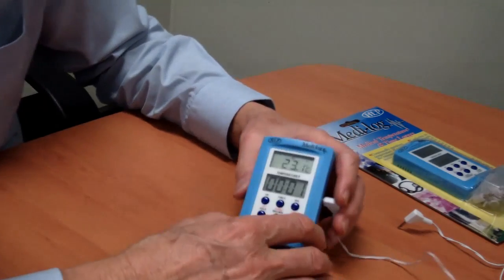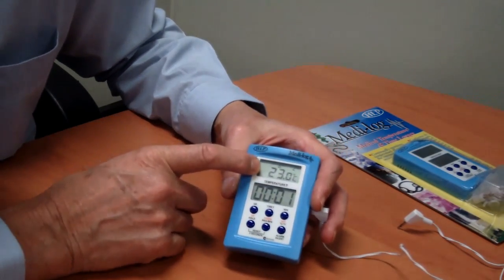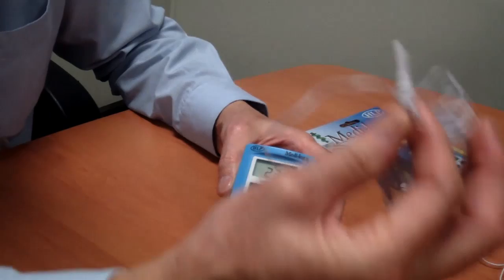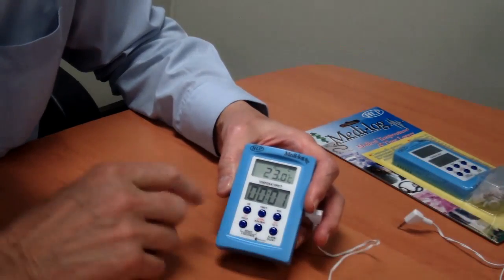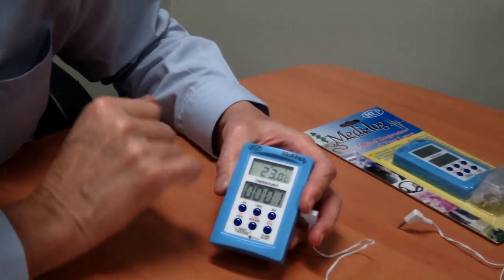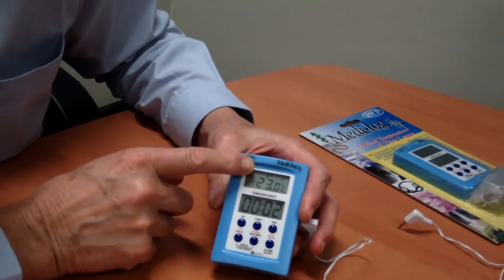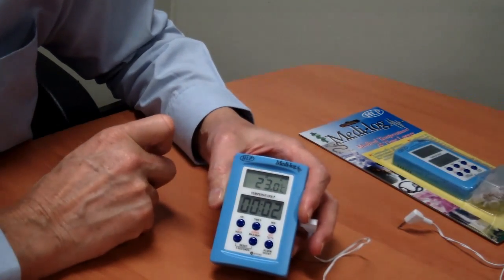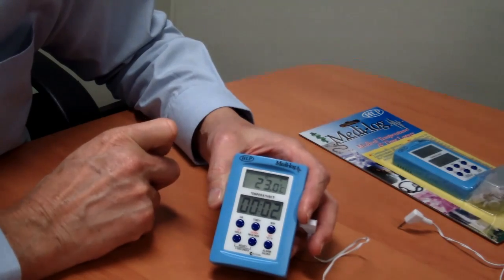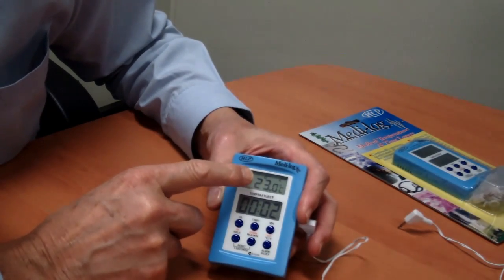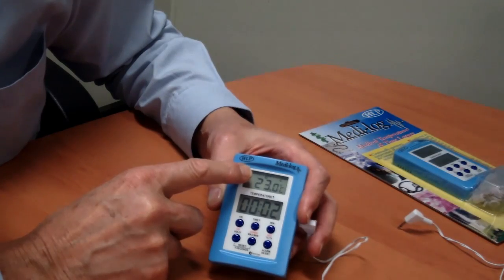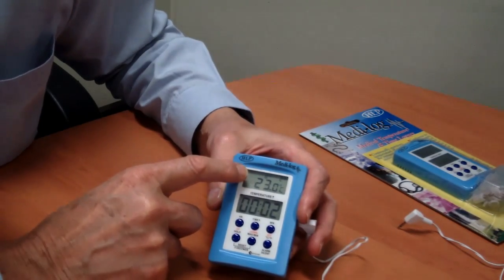With this unit, the top display shows the temperature. If that was inside the refrigerator, then that would be the temperature in the fridge. It shows the settings at the top, which are eight and two degrees, which are the alarm settings already built into the unit. The eight is actually flashing because it's letting me know that the actual temperature in the fridge is above eight, so I can see at a glance that it's high and the high alarm is going.